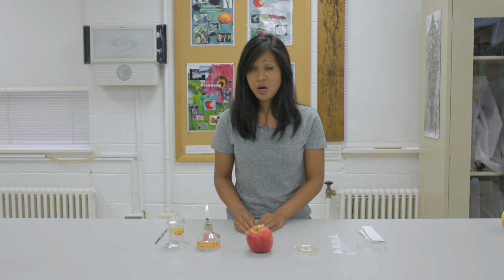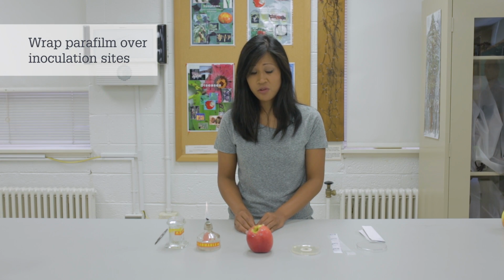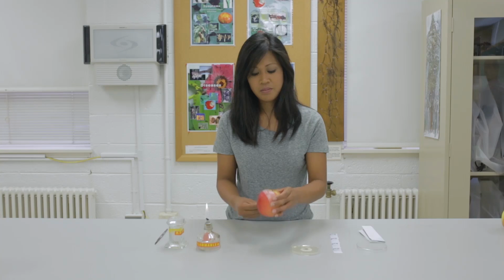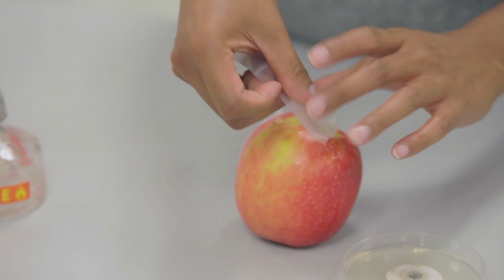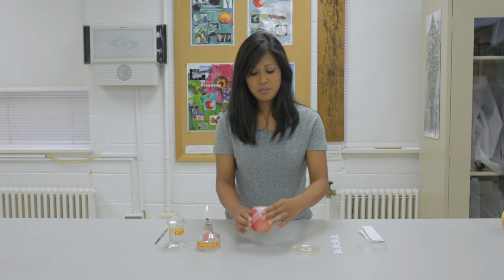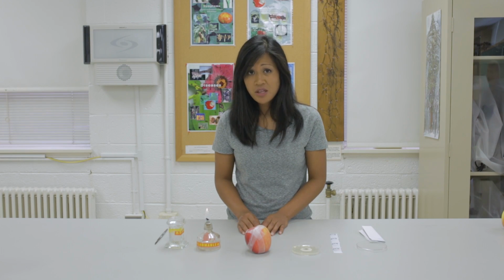We will now put parafilm over the inoculation sites to ensure a favorable environment for infection. We will now incubate the apple and observe daily for symptom development.